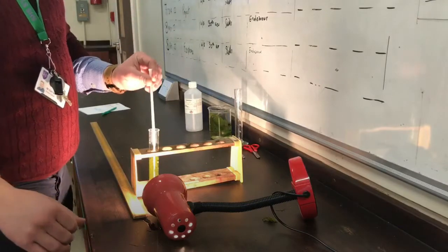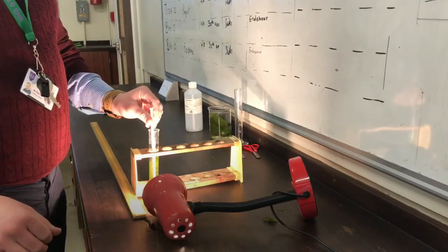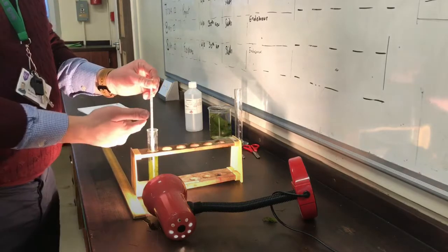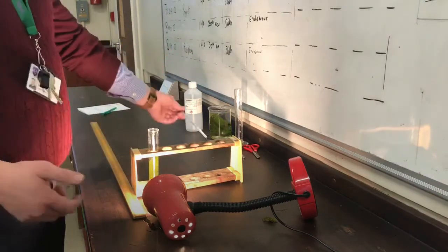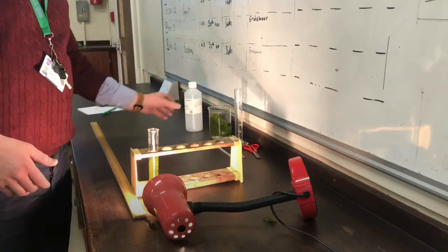And using my thermometer, which is my control variable, sorry my control measure, I will be ensuring that we keep and maintain a regular temperature.